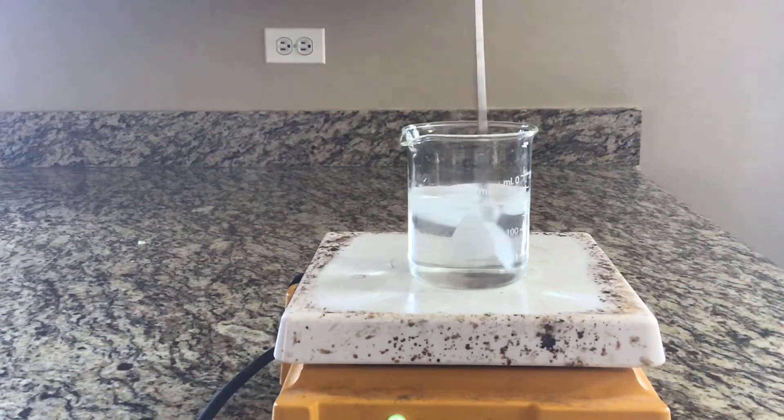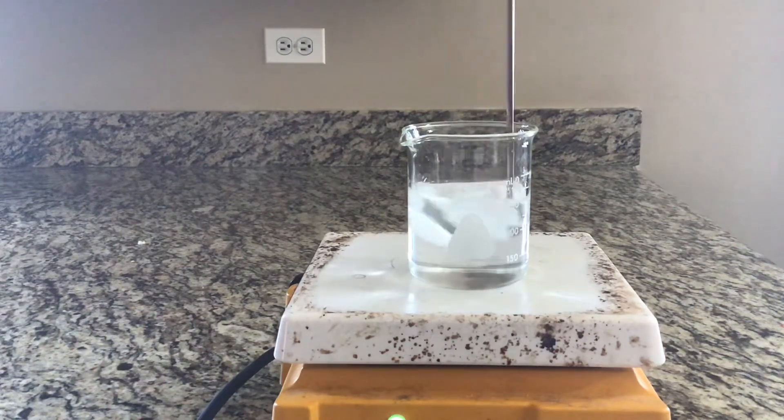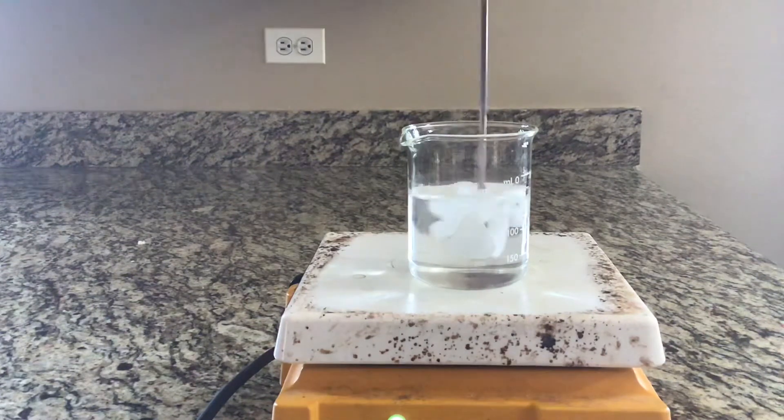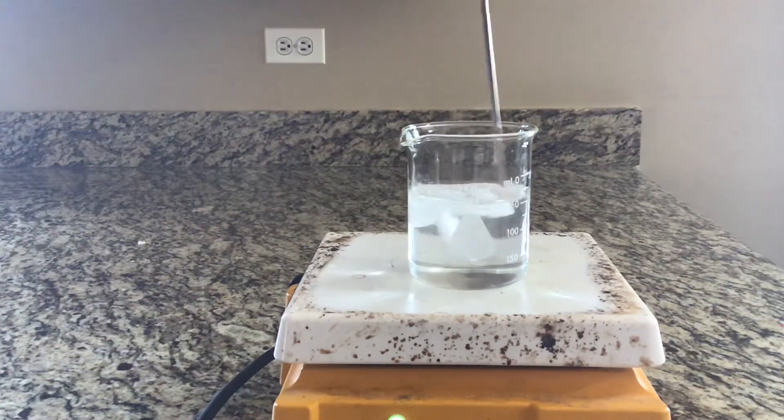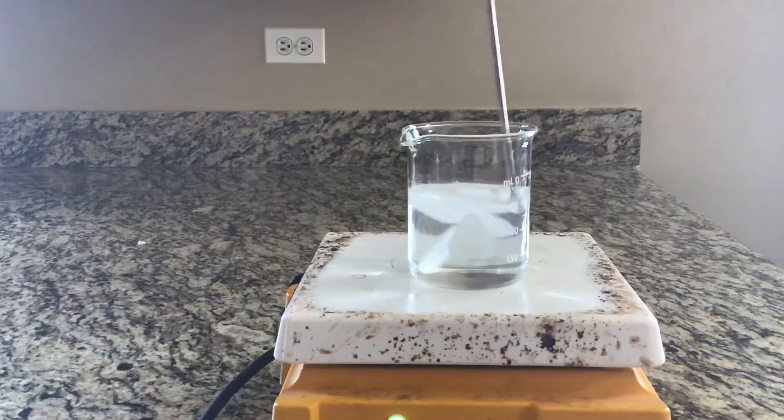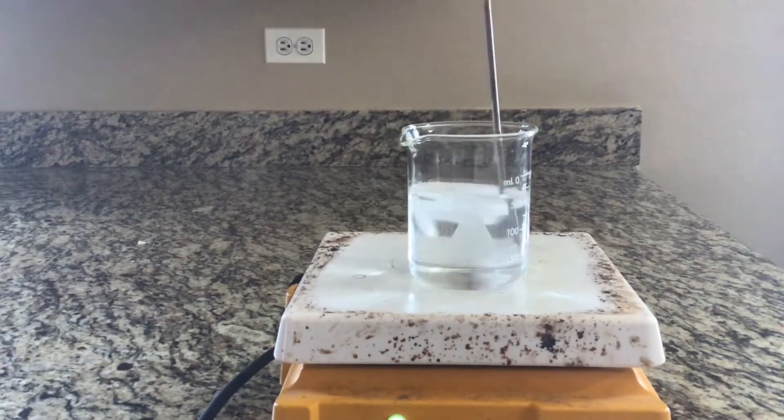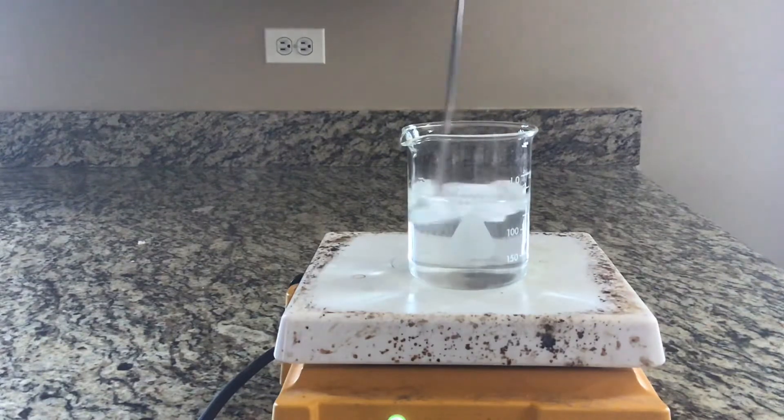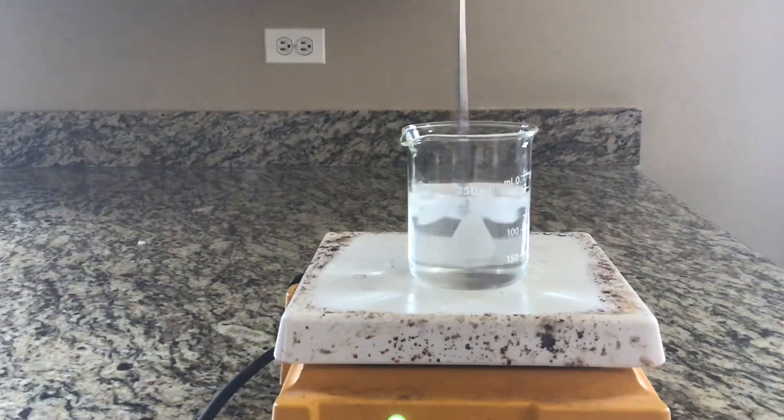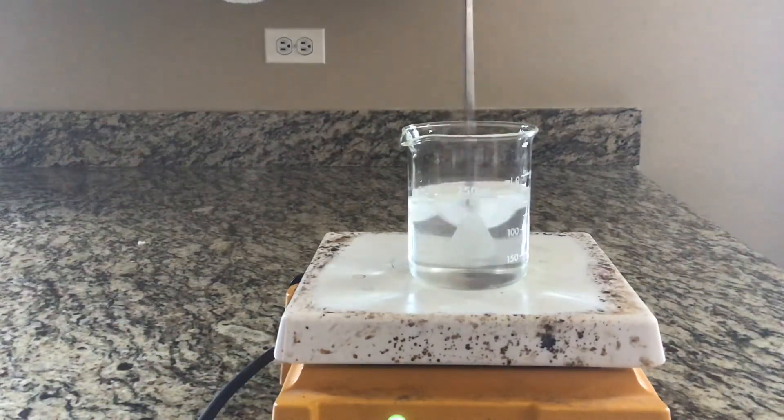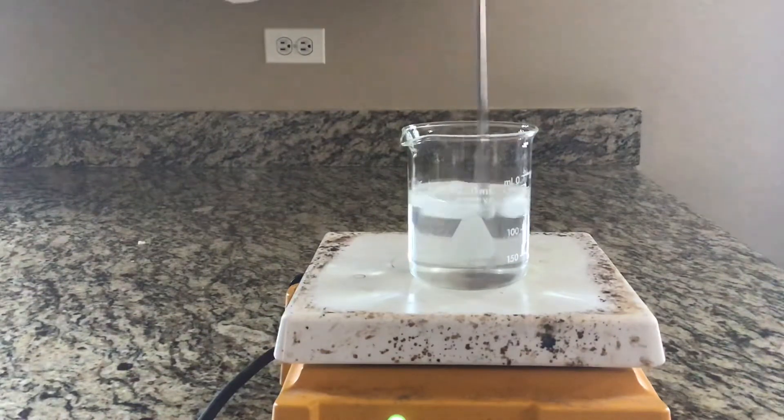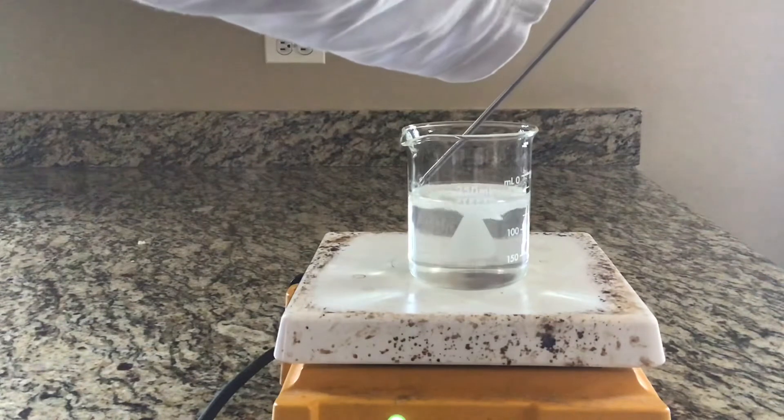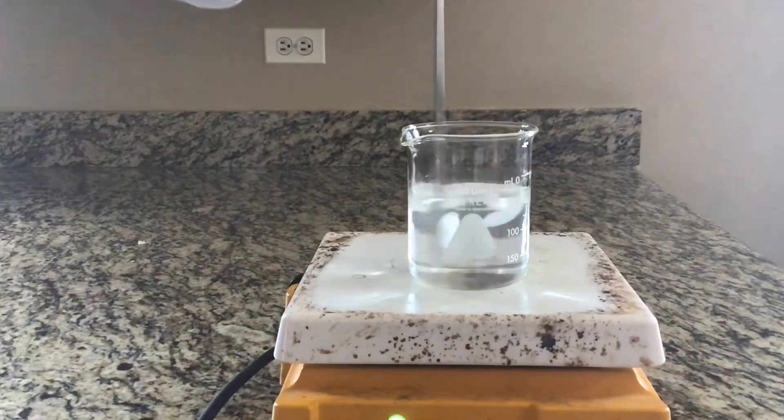Let's keep stirring. Another 20 seconds is coming up and we're at 5.6 degrees Celsius. Again, we still have ice water in there.